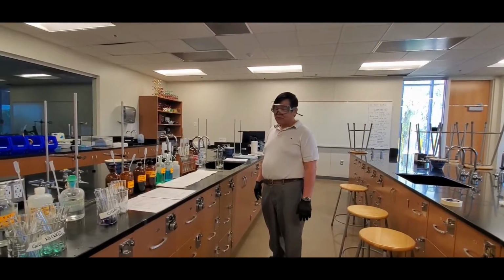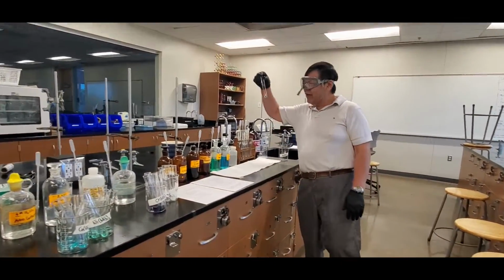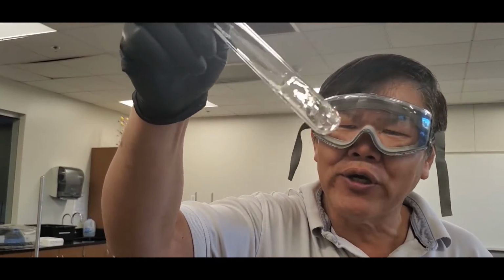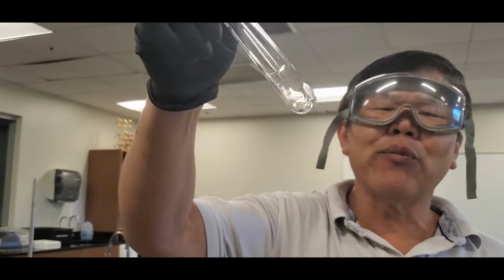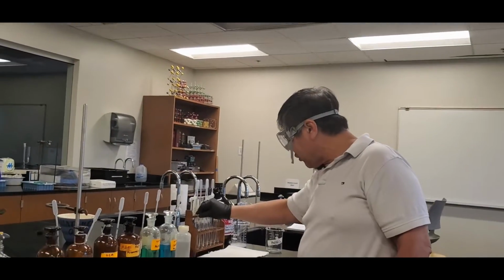All right, class, next one. We'll do the manganese nitrate. Now take a look at this guy right here. This guy is kind of peachy pink or so originally. Now typically when they make it more dilute, it's kind of clear, okay? So again, same procedure, okay?